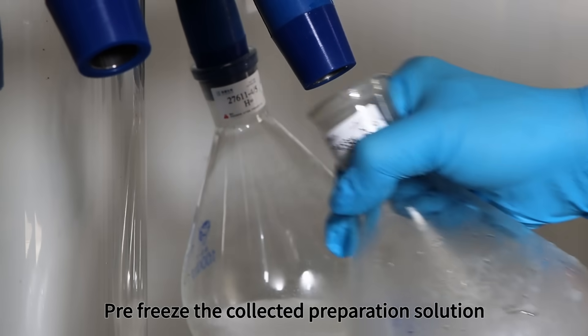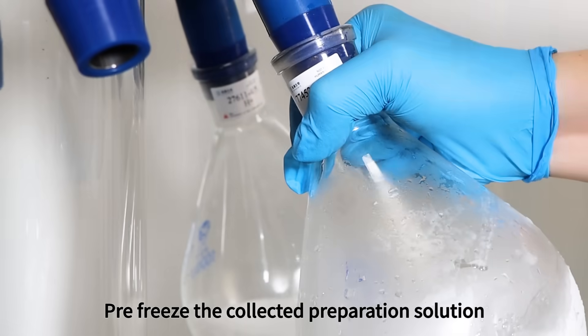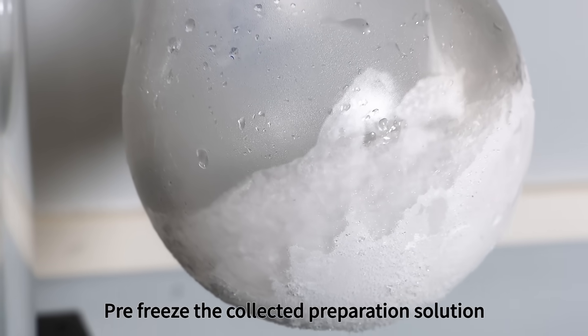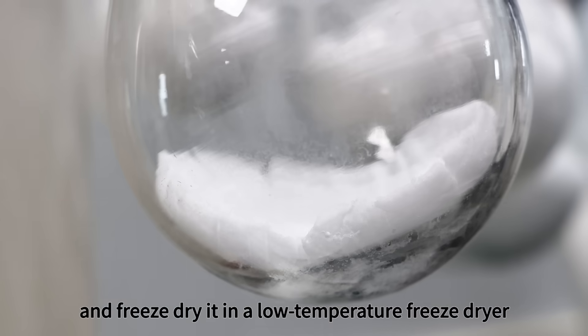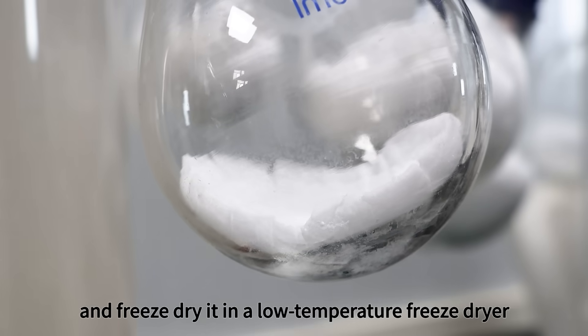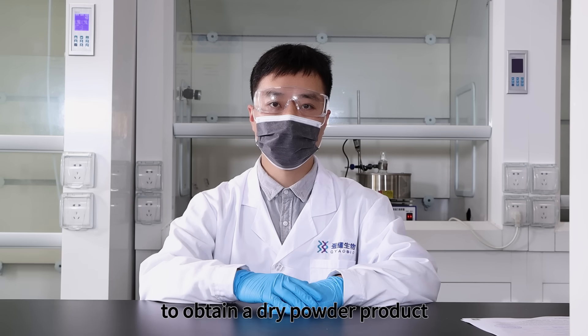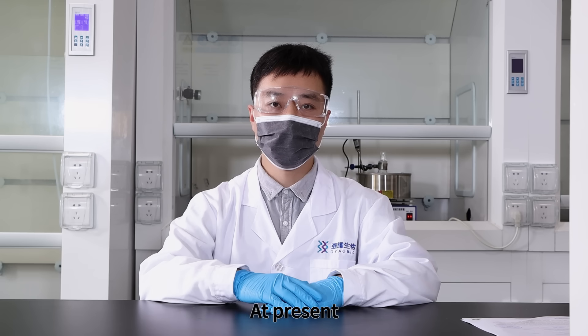Step 6: Dry powder of product. Pre-freeze the collected preparation solution with liquid nitrogen and freeze-dry it in a low-temperature freeze dryer to obtain a dry powder product.